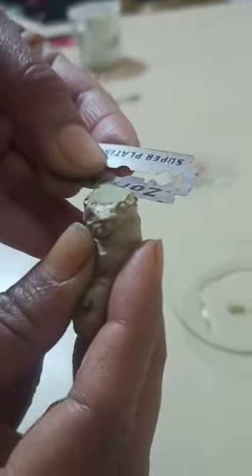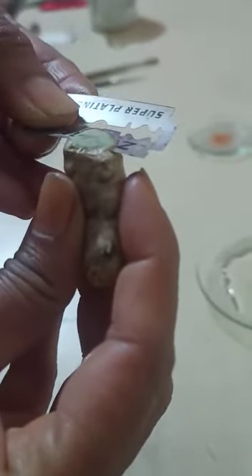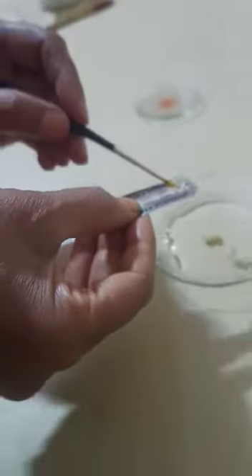Transfer this section with the help of a brush into the water. Take another section and transfer this section with the help of a brush into the watch glass. Take a sufficient number of sections, then select thin uniform sections.